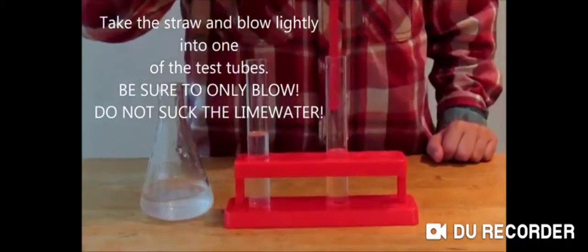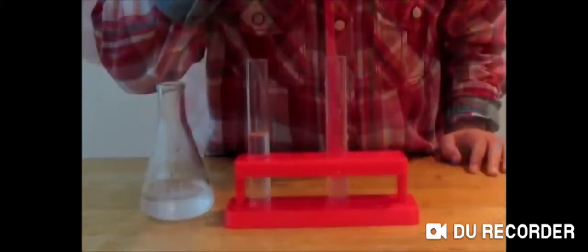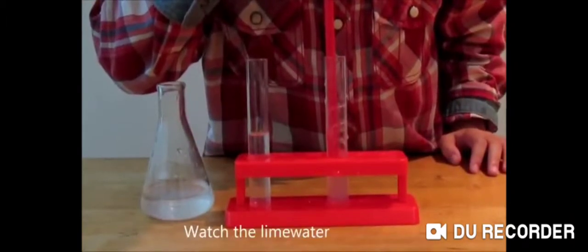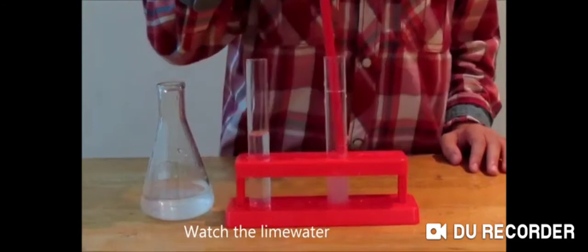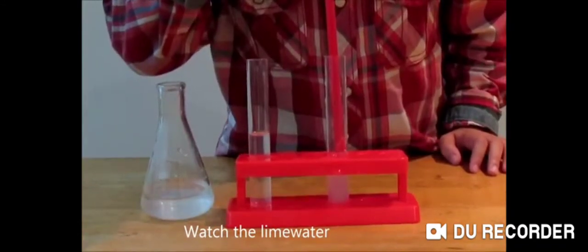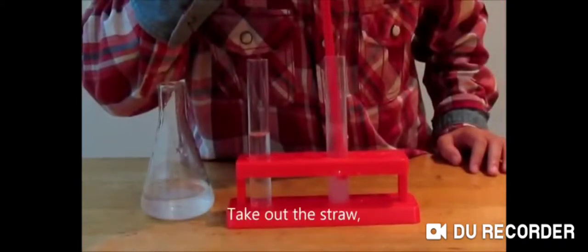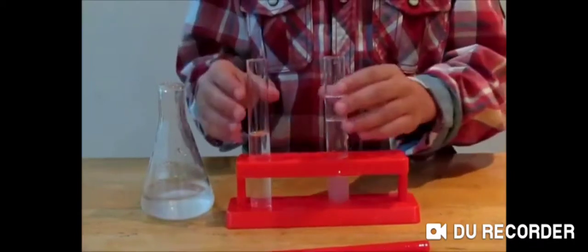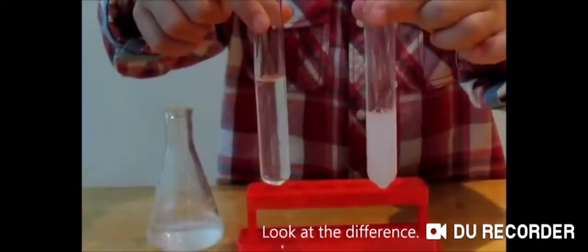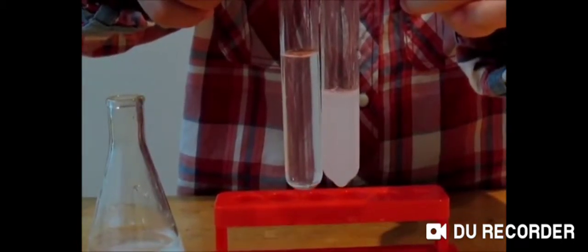Take the straw and blow lightly into one of the test tubes — do not suck. Watch the lime water. Take out the straw. Look at the difference: the lime water turns cloudy. This signifies that carbon dioxide is present in your breath.